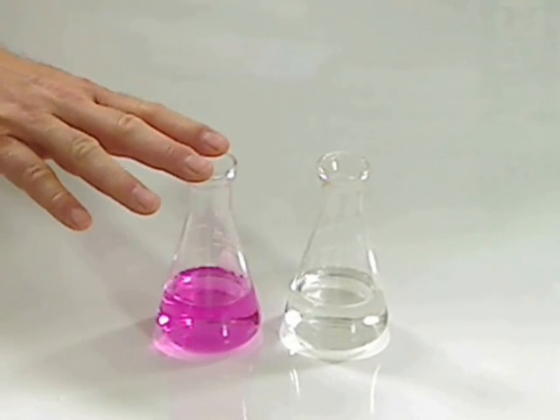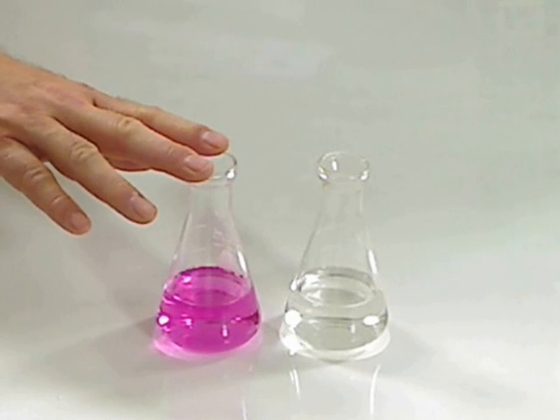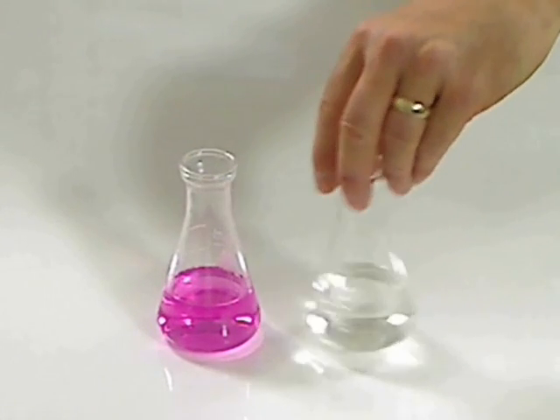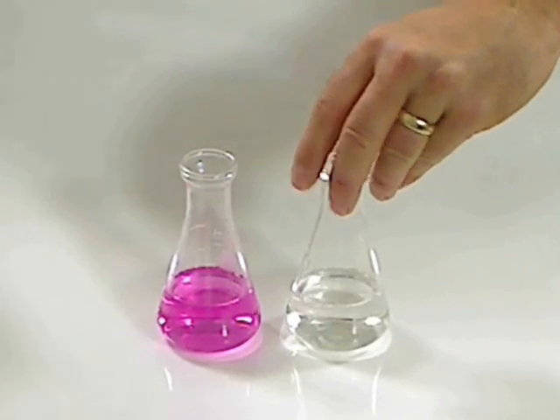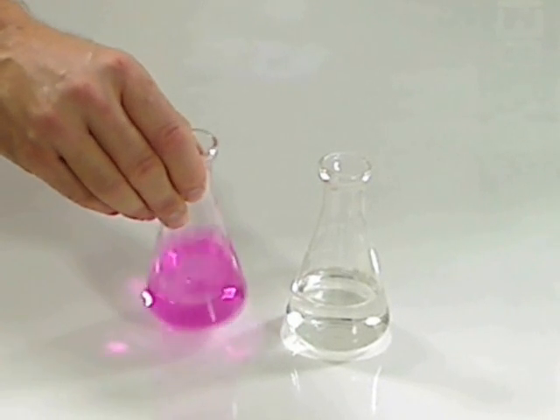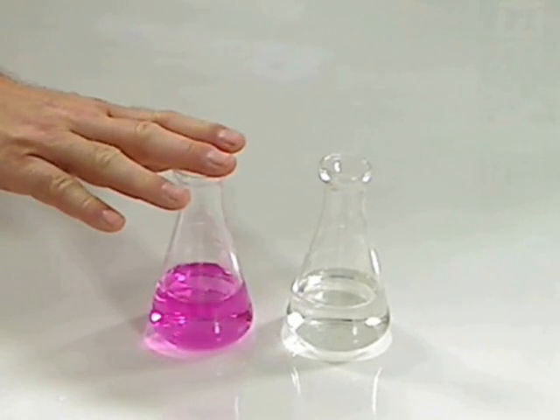And at pH 10 or higher, it's a deep pink. So in an acidic solution, it's going to be colorless, and in a slightly basic to strongly basic solution, it's going to be pink.